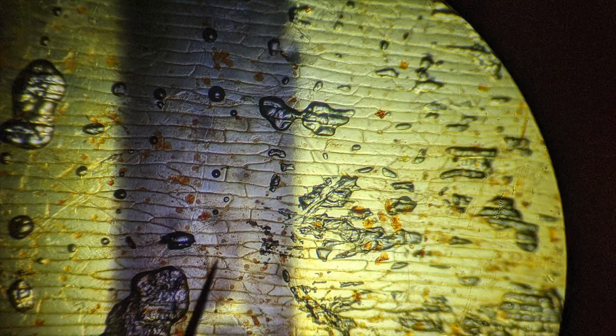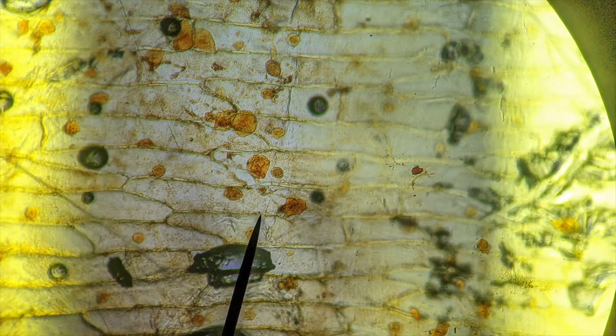This video shows a pretty cool lab technique for measuring the size of cells. You can see a one millimeter marker line placed by a Sharpie fine tip marker on a slide. A single membrane of onion is placed on there, followed by a cheek rubbing of simple squamous epithelial cells from the cheek, stained in iodine, and a cover slip applied.